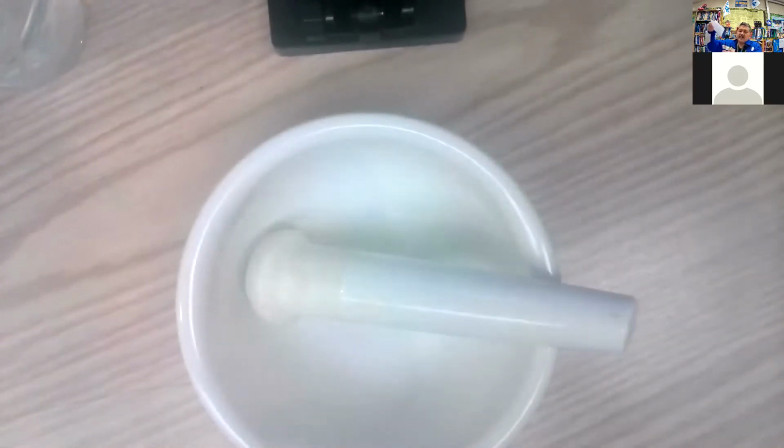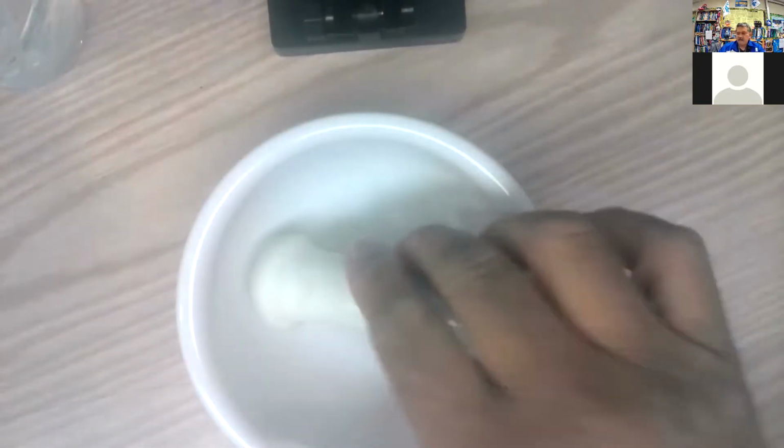it'll be easy to use this like a spout to pour it down the paper into the balloon. Okay. All right. So let me try it without this. Let's see what I have around here. Got a coffee mug. Maybe you could use that because you probably don't have a mortar and pestle around.